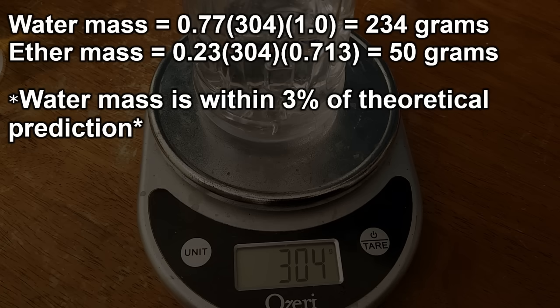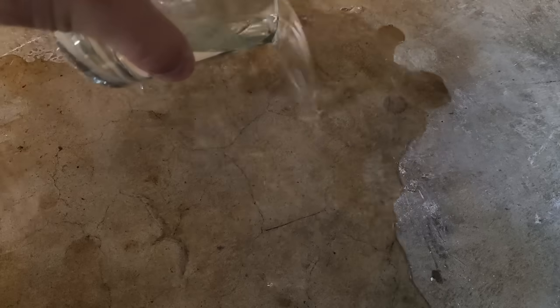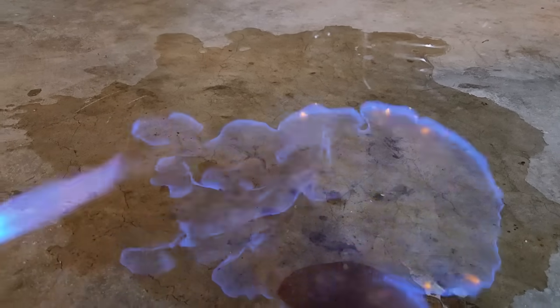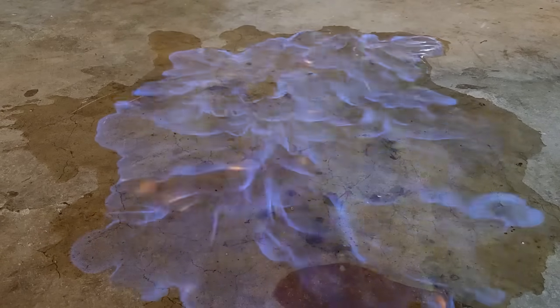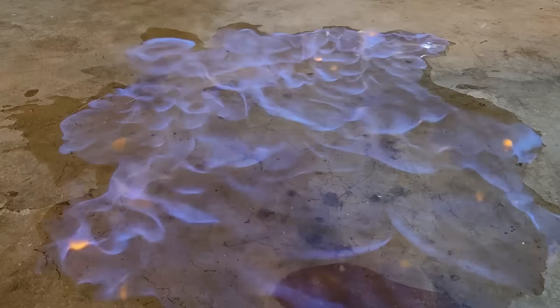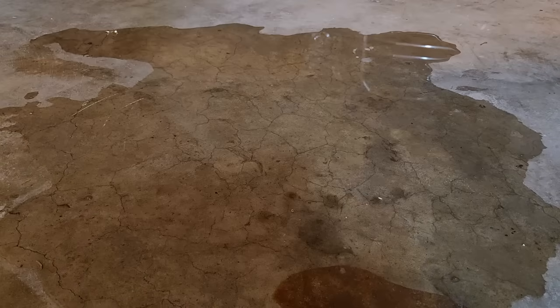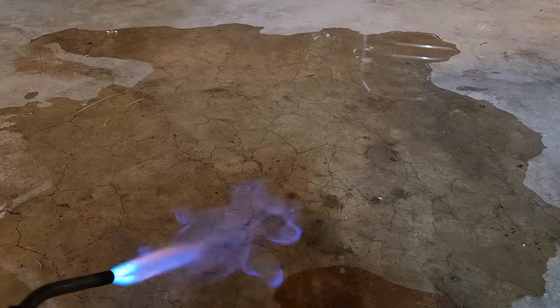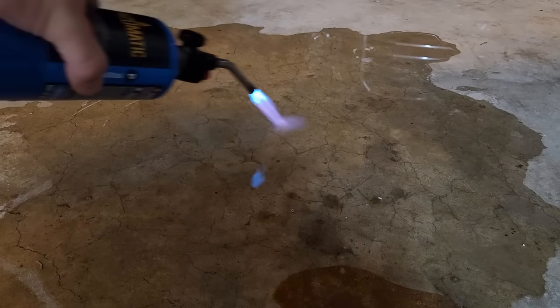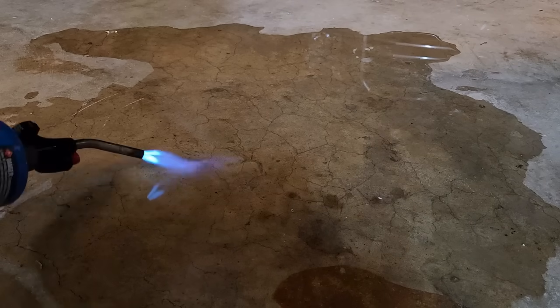Let's see how flammable this stuff is. It's mostly water, but ether is so incredibly volatile that it should still light up. And there it goes — quite an impressive display. However, if this was 100% pure ether I would have incinerated myself and my camera by now. Once the flame goes out there's still a good amount of liquid left over that I can't ignite, which is the water.